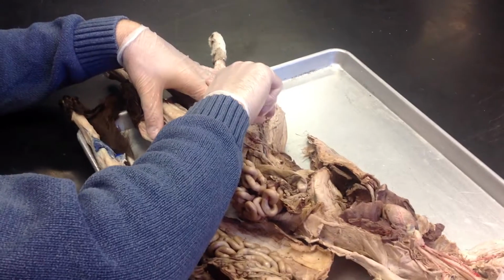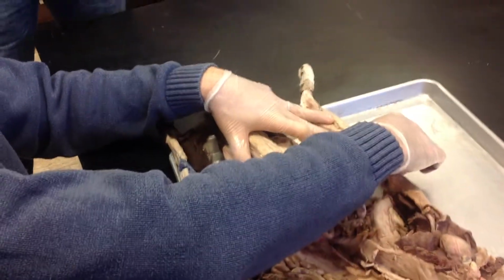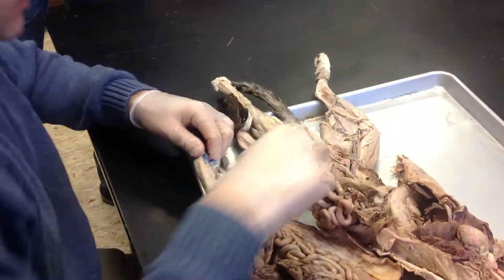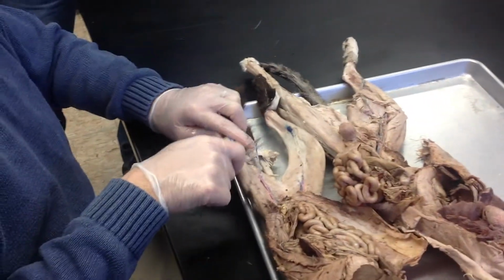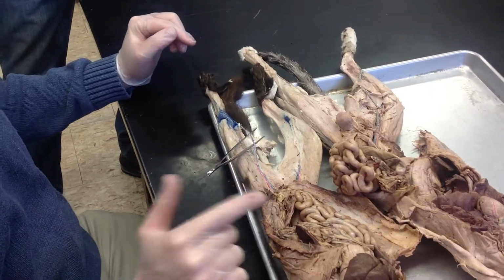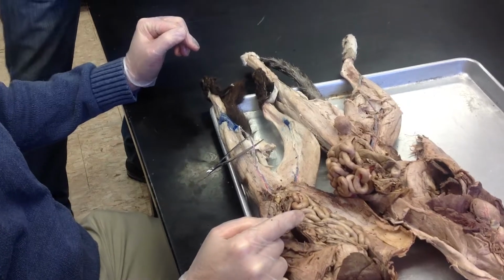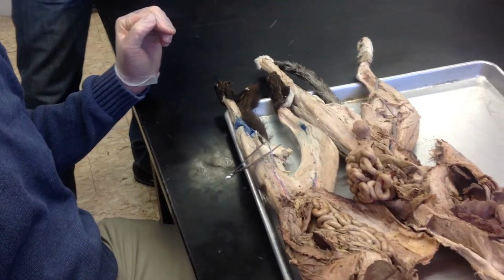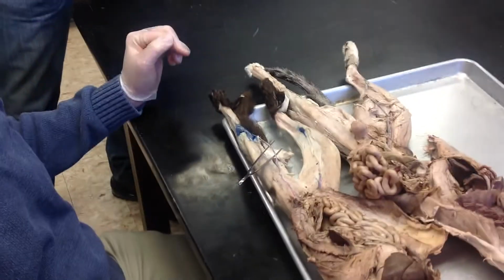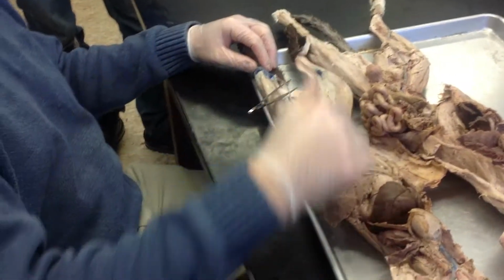Once we get into the lower leg, it branches to make a Y. You can see the Y. But right there now, it's a tibial artery and vein. Now, there is also an alternate route back here. You can see it here and it broke there. This is the great saphenous vein. So you can get back from the foot to the femoral vein without going through the popliteal. This is the saphenous vein. You probably even noticed it in A&P1. Once you take the skin off, it's just right deep to the skin.